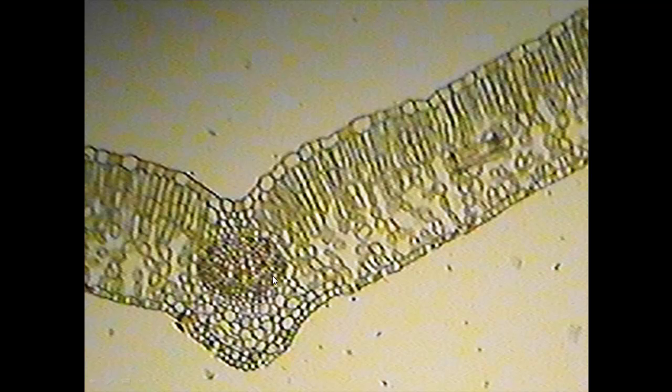In the middle I can make out this kind of circle. This is the central vein, and it consists of xylem. I can see bigger circles in the upper part, and phloem I can't really see circles, it's much more dense. Those would be the phloem down the bottom here. There may be bundle sheath cells around the outside, a little bit difficult to see. If you can't see them so clearly, just draw it as a circle and label xylem as the larger circles and phloem as the smaller, tighter ones.